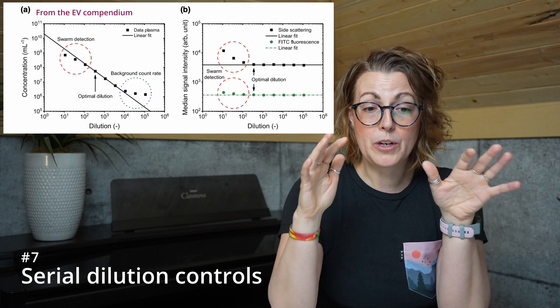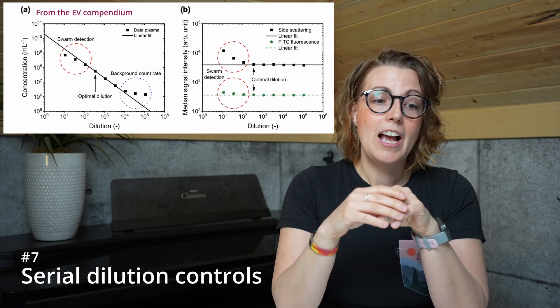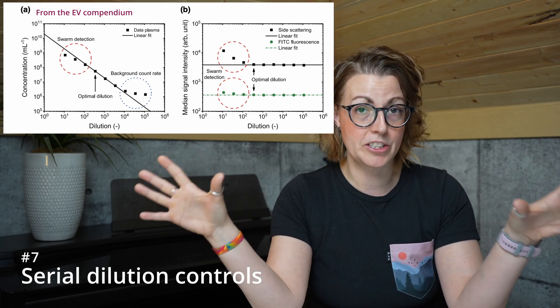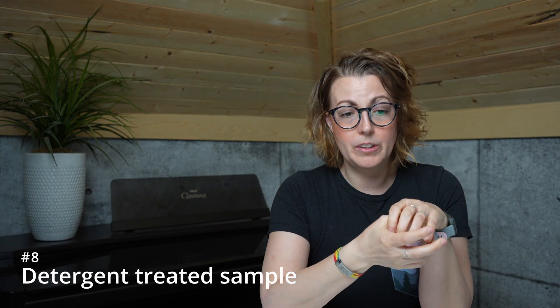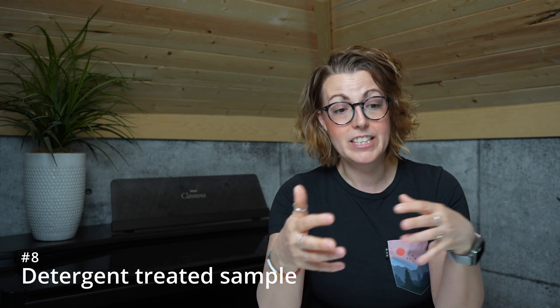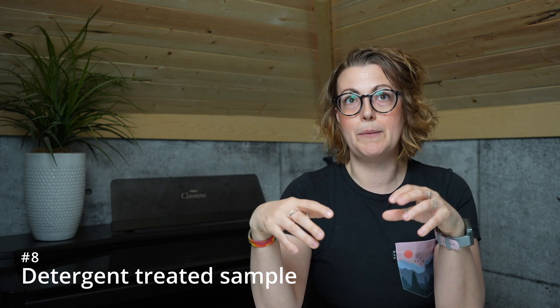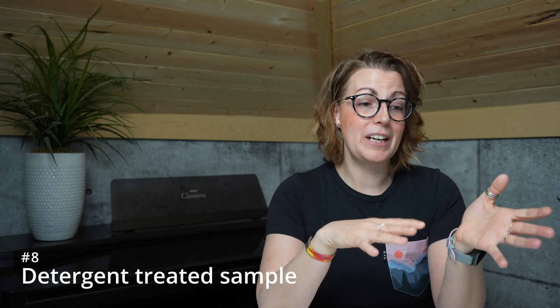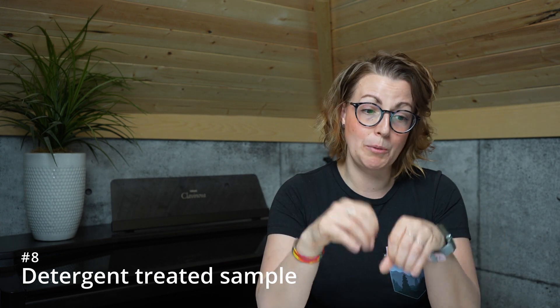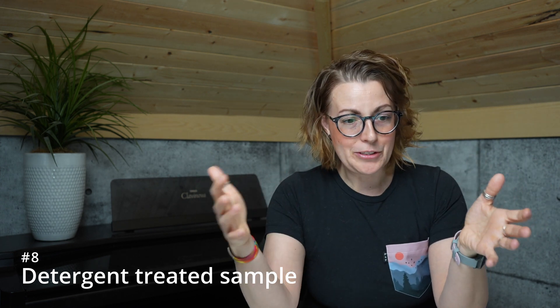As you can see in this figure, the samples should have a linear decrease in events — your event rate should go down as you decrease the concentration — and a steady median fluorescence intensity. When you have swarm, you won't see those responding linearly, and that's how you know which regions to avoid. Finally, the last control is the detergent-treated sample. This allows you to differentiate detergent-sensitive membrane-enclosed particles, such as cells and EVs, from detergent-resistant particles such as detergent-resistant membrane domains, immune complexes, and lipoprotein particles. They can help determine if what you're looking at is or is not a biological particle, though the detergent can also form micelles which may itself introduce artifacts.